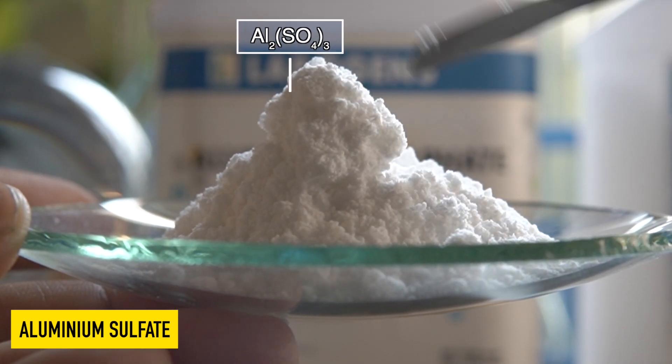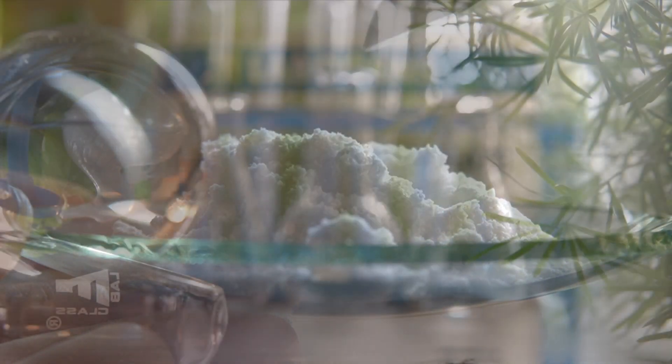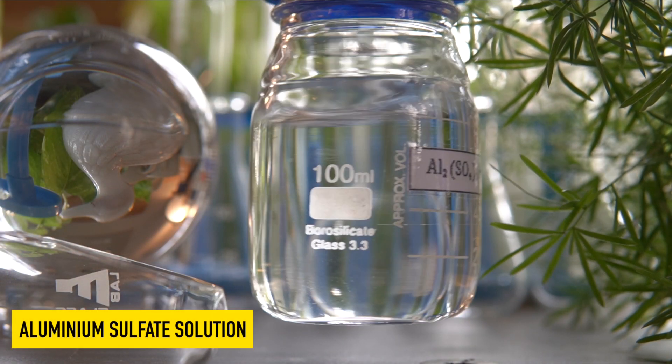This is aluminum sulfate, a white powdery substance that can dissolve in water very easily.